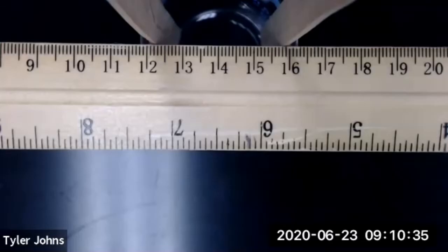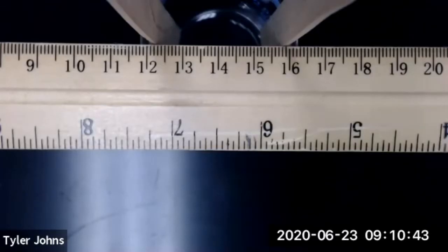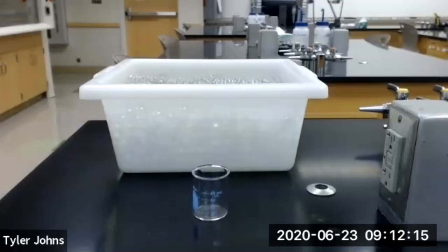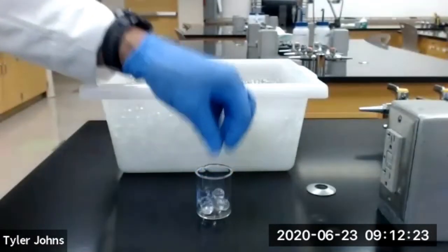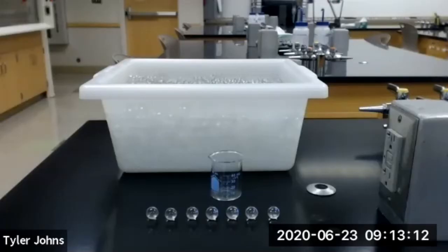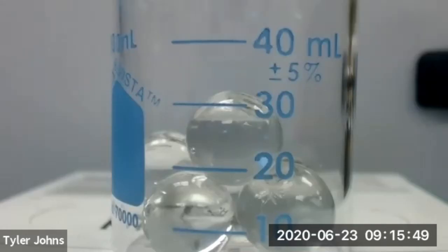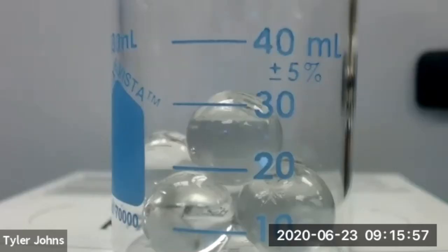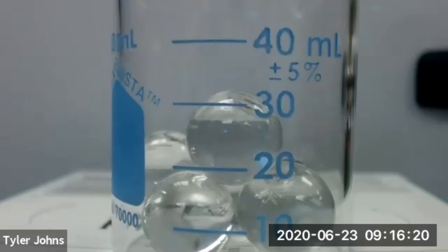Cylinder B for our marbles is going to be a 50 milliliter beaker. This is the inner diameter of our 50 milliliter beaker. We next need to fill our 50 milliliter beaker or cylinder B at least halfway full with marbles. This is the number of marbles in cylinder B, and this is the total volume occupied by the marbles in our 50 milliliter beaker or cylinder B. You can now calculate the diameter ratio and the packing efficiency for cylinder B, our 50 milliliter beaker.